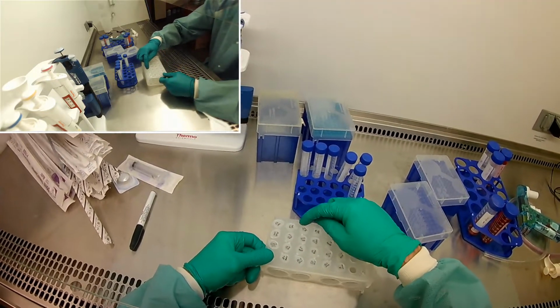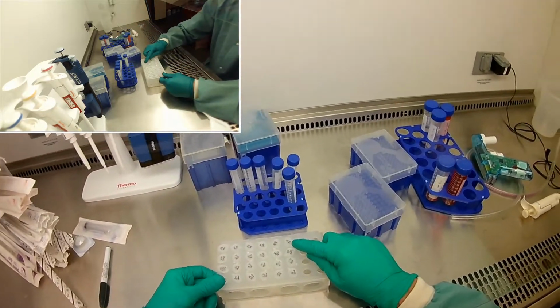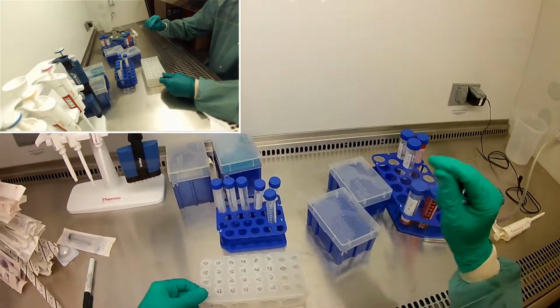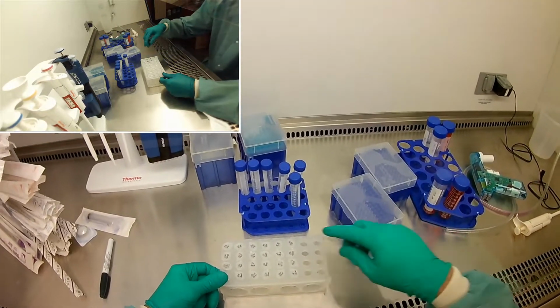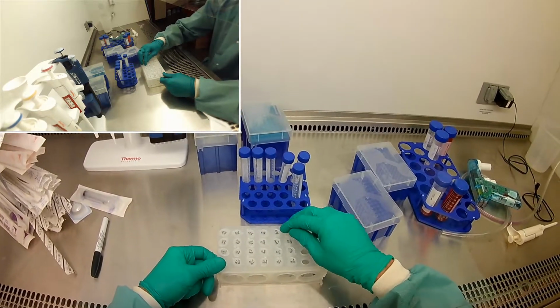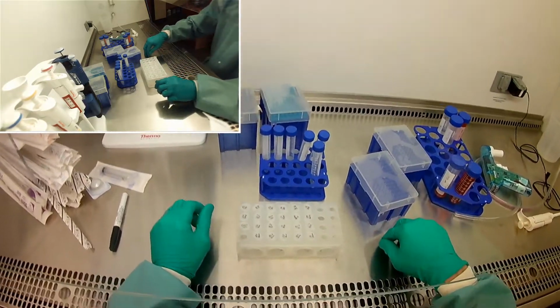But I'm basically going to test antibiotics. So our normal antibiotics are 1%, right? But when we dilute into 2% FBS, we not only take the FBS down from 10 to 2%, we take the antibiotics down from 1 to 0.2%. So I'm going to put some 1% antibiotics, I'm going to do some 2% antibiotics, 4%, 8%, and then also 12% antibiotics.